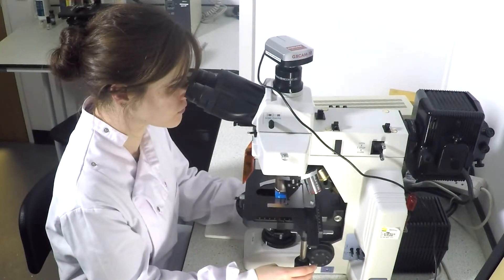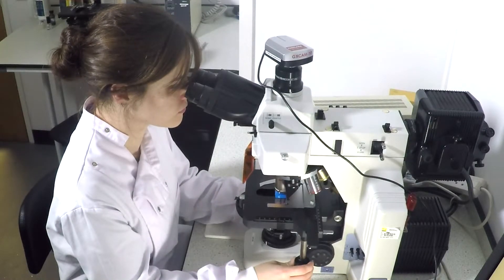Once slides have been stained, they should be identified and enumerated using microscopy.